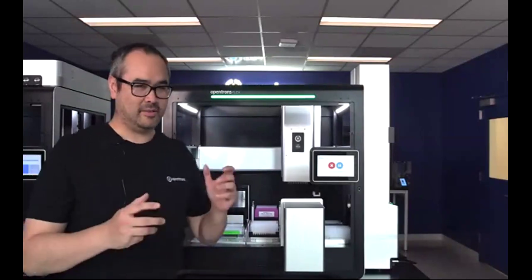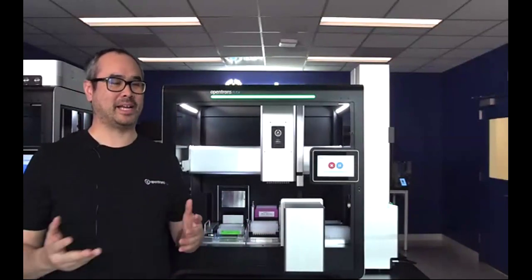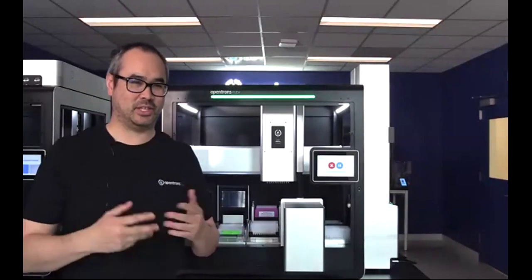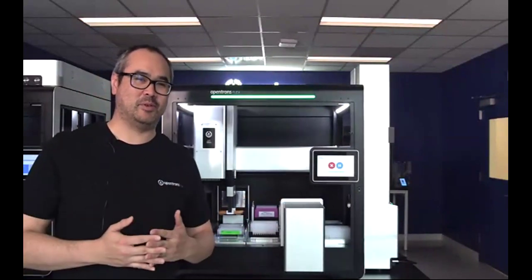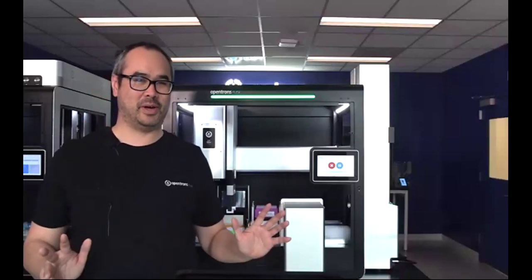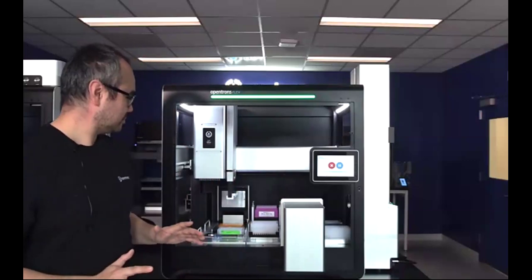Our target client would be a small clinical lab that is receiving small batches of samples consistently throughout the week, doing small batches of like 24 or 16, maybe even 48. So the idea of automating that would be to have the same protocol being run consistently and completely walk away. So we want to automate the steps and the entire workflow.